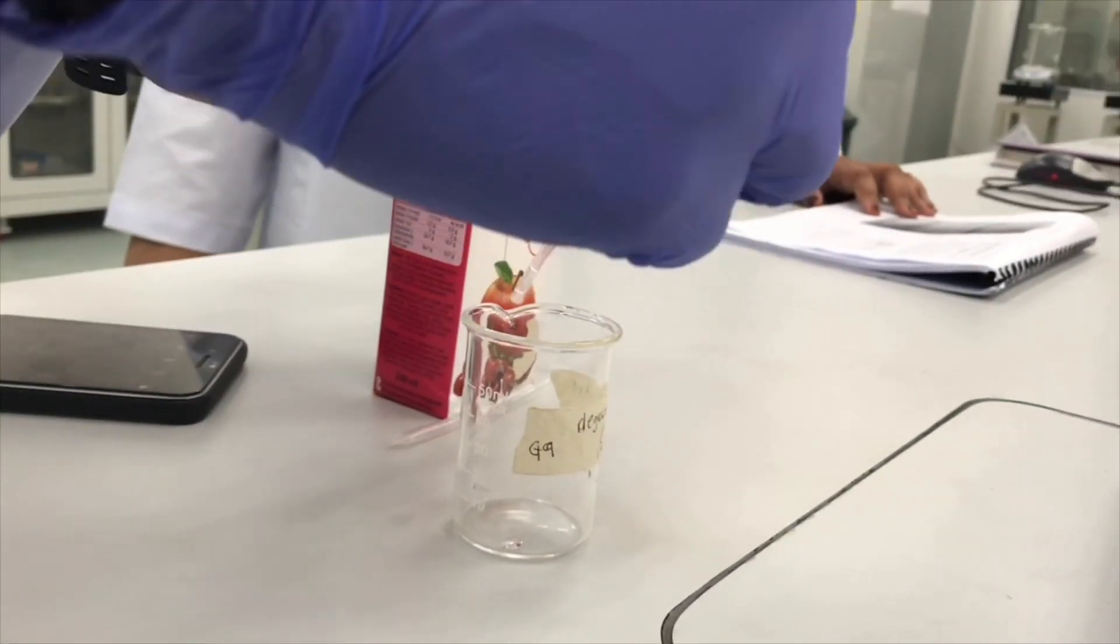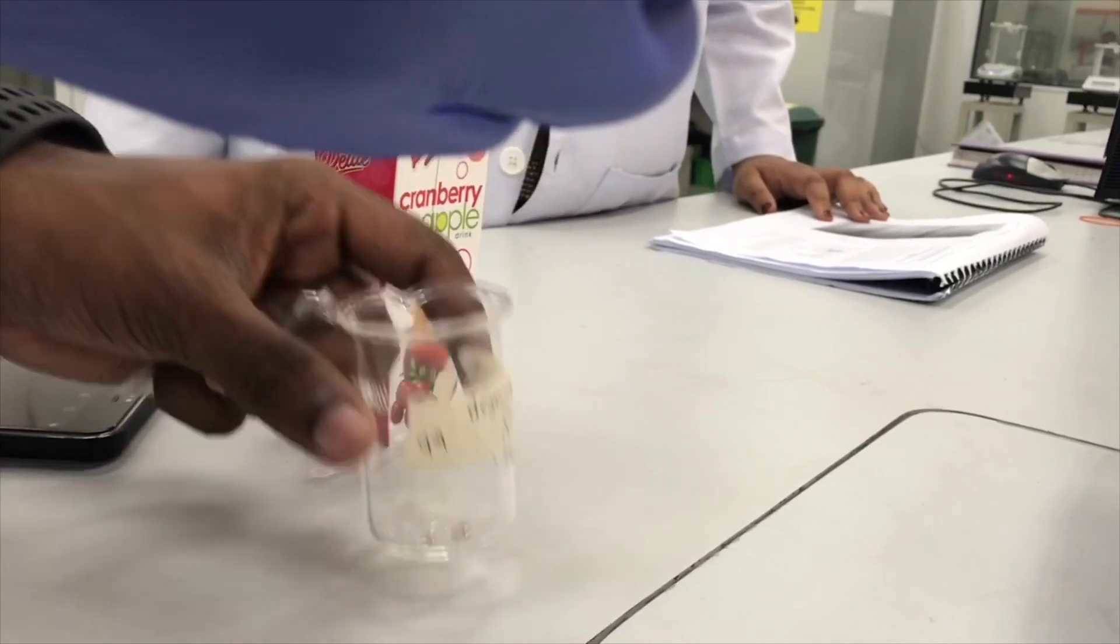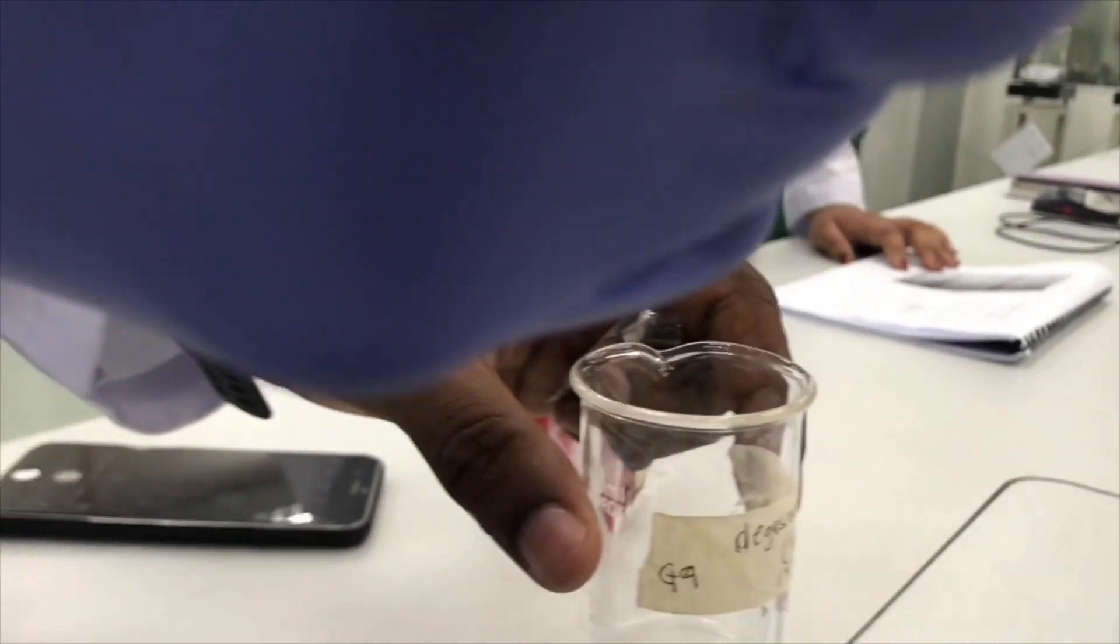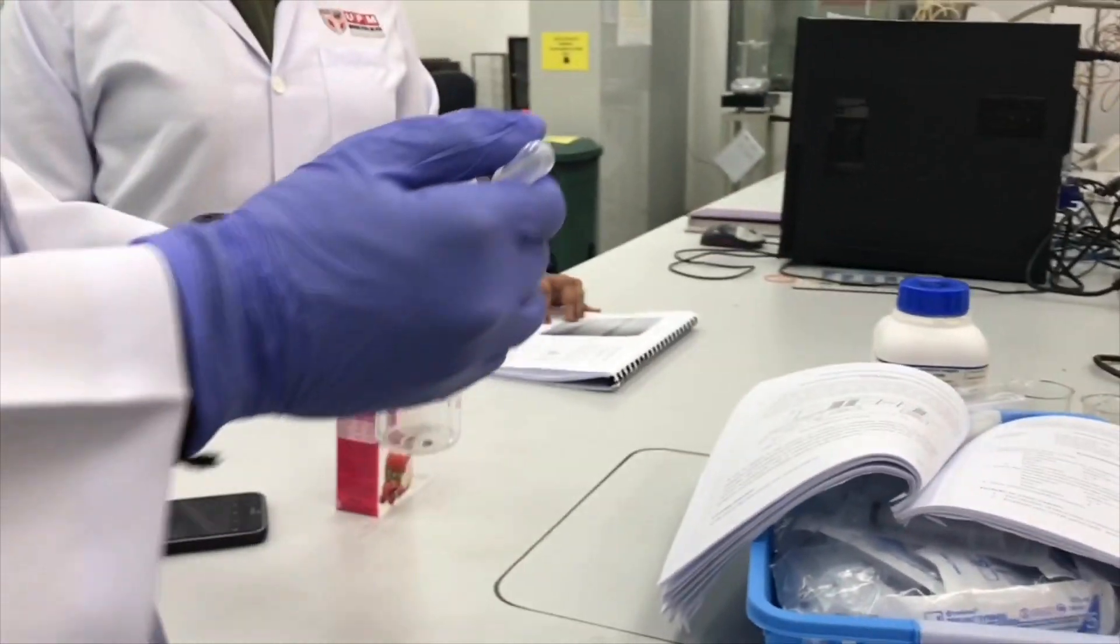We use beverage as our sample in this experiment and we just need a little and put it in the beaker.